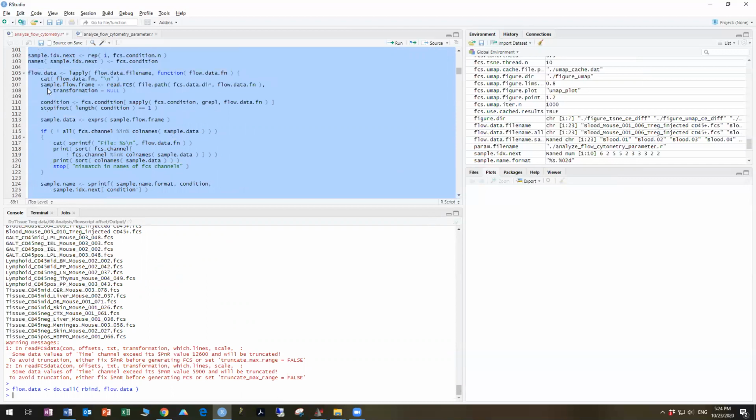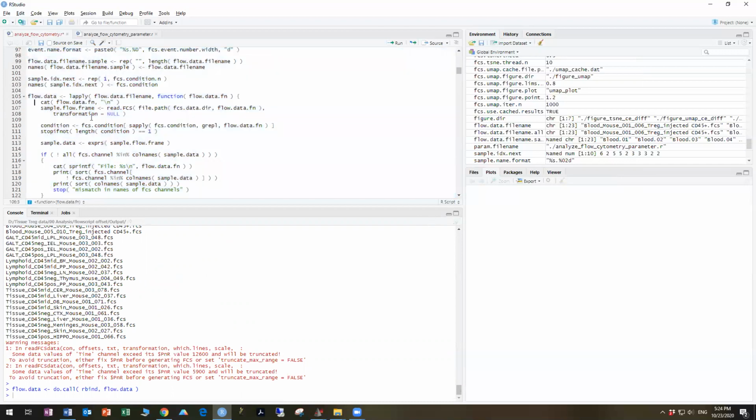All right, so then at the end of that, what you can do is put the hashtag back in by doing Command Z, or just typing it in. And then if you just do Command Z, it reverts the change and you don't need to save it. And that's that. That's how you remove the offset error files.